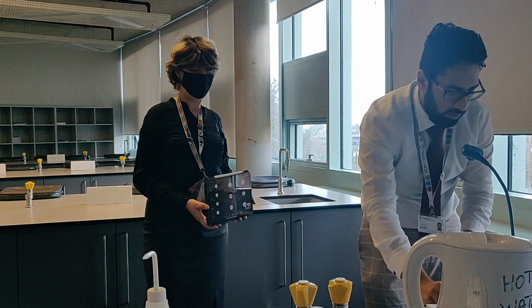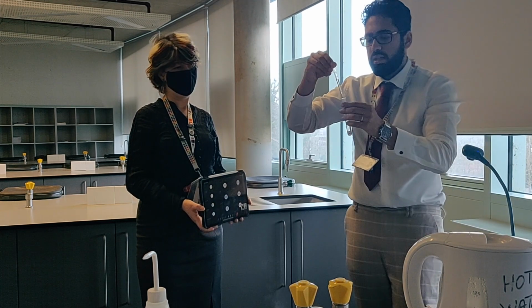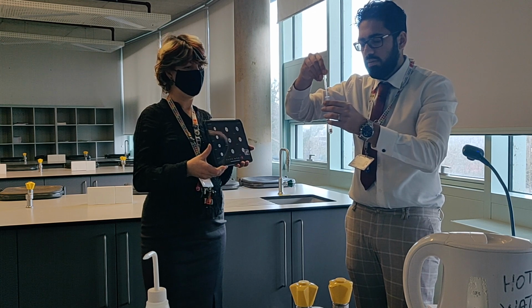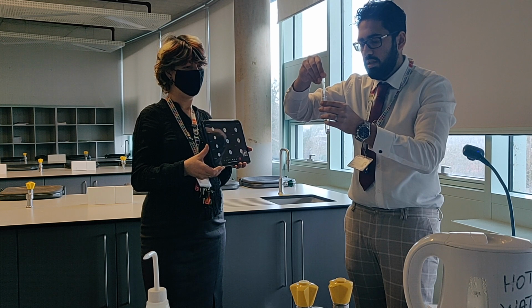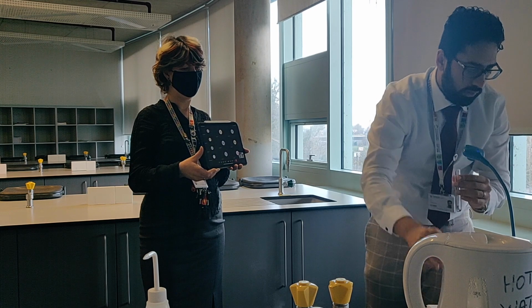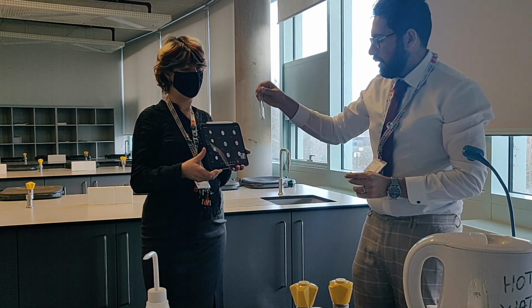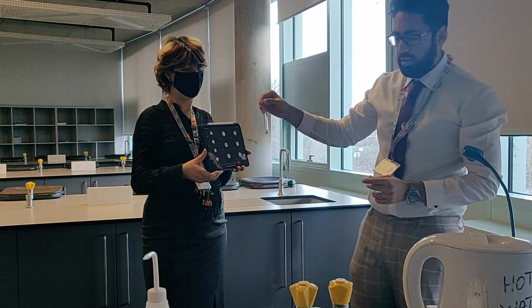And my sodium hydroxide, about 1 centimeter cubed. So probably around the same, around 10 drops. 2, 3, 4, 5, 6, 7, 8, 9, 10. Okay, then it says record your observations. So you can see that it was red initially, and again it's gone to a blue colour. So it's gone from red to blue.